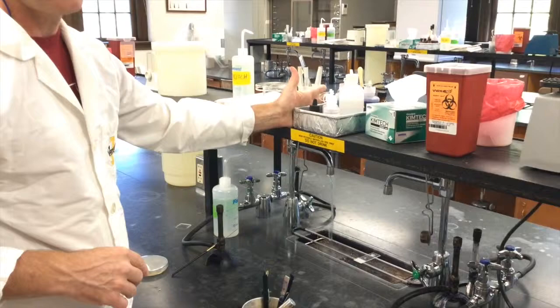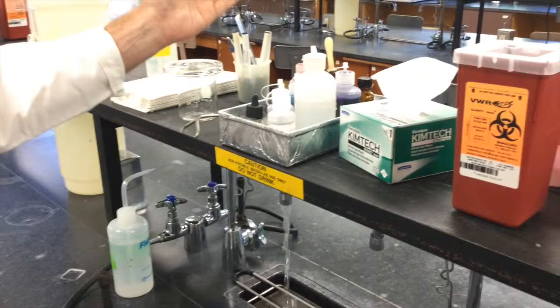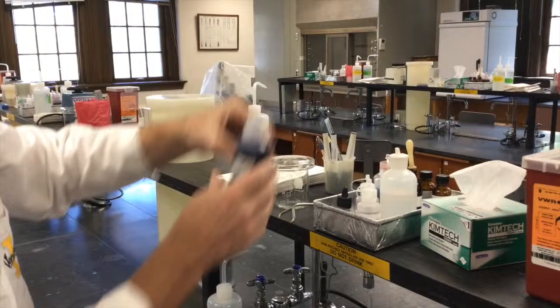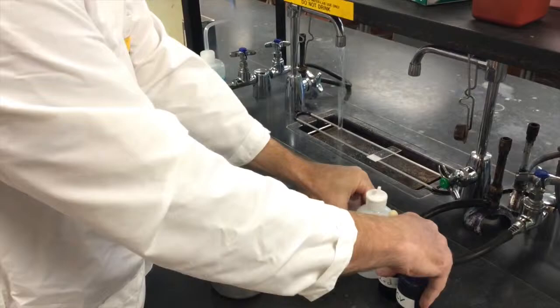On the benchtops you'll find kits, staining kits, and a collection of various kinds of reagents used in various staining procedures. Today we're doing the Gram stain. And so we're going to need, first, a primary stain, the crystal violet. It's labeled as CV in this case. That's our primary stain. We need a mordant or a fixing reagent. In this case we call it iodine. And so that's our mordant. We're then going to need to de-stain the primary stain. And our de-stain in this case is 95% ethanol. And then finally, to counter-stain, we're going to add safranin. So we're using four reagents plus water.